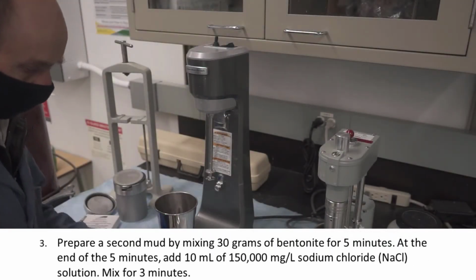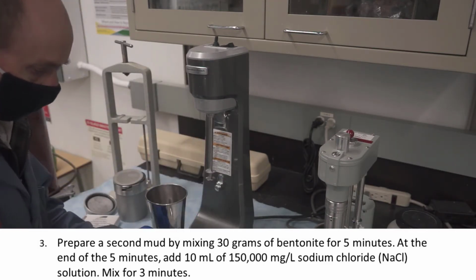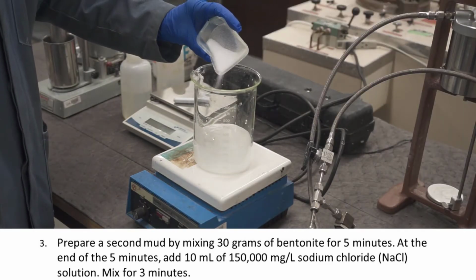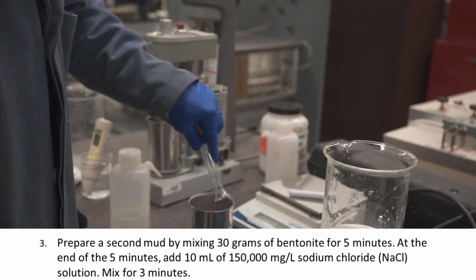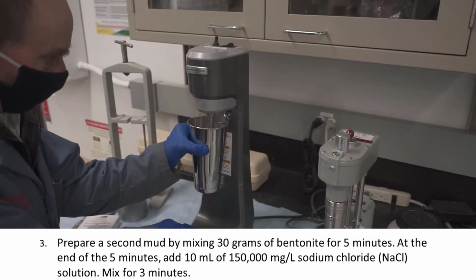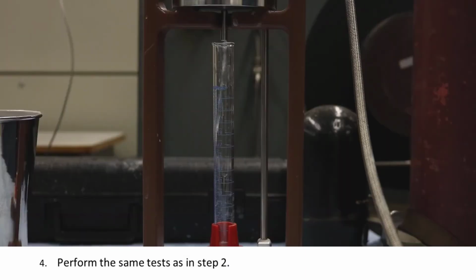Prepare a salt-contaminated mud sample with 30 grams of bentonite and 350 cc's of water, just like you did in step 1. After mixing for 5 minutes, add 10 milliliters of a 150,000 milligram per liter sodium chloride solution, then mix for another 3 minutes. Perform the tests from step 2 on this contaminated mud sample.